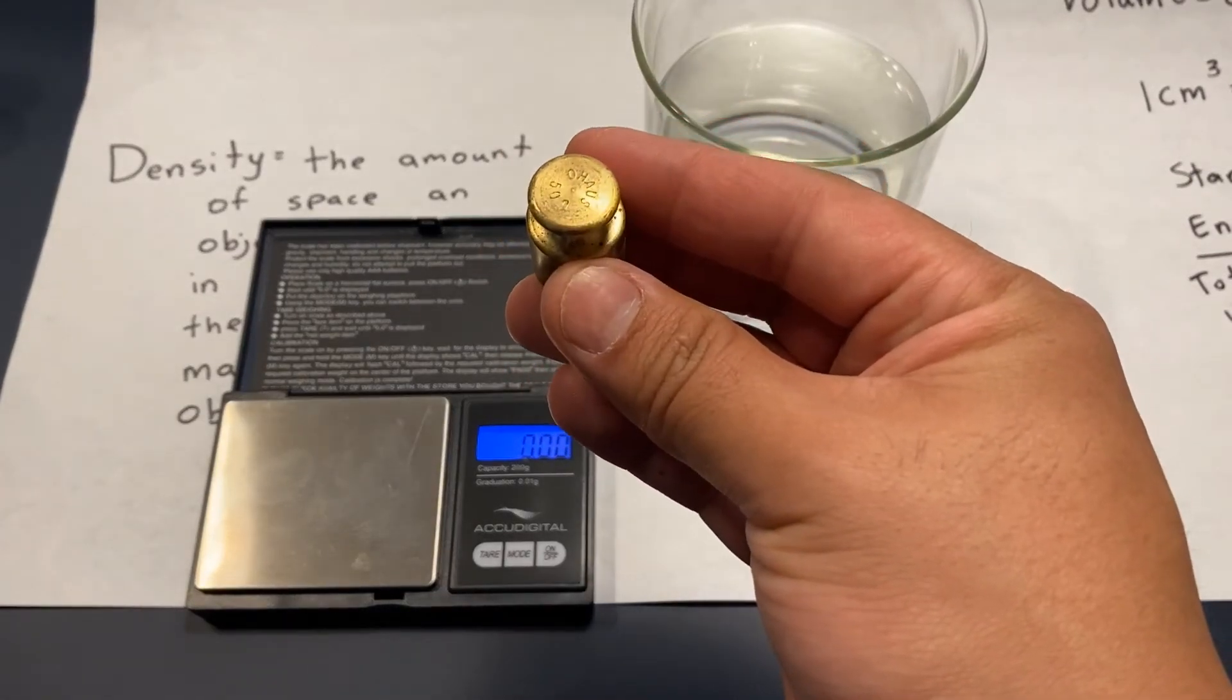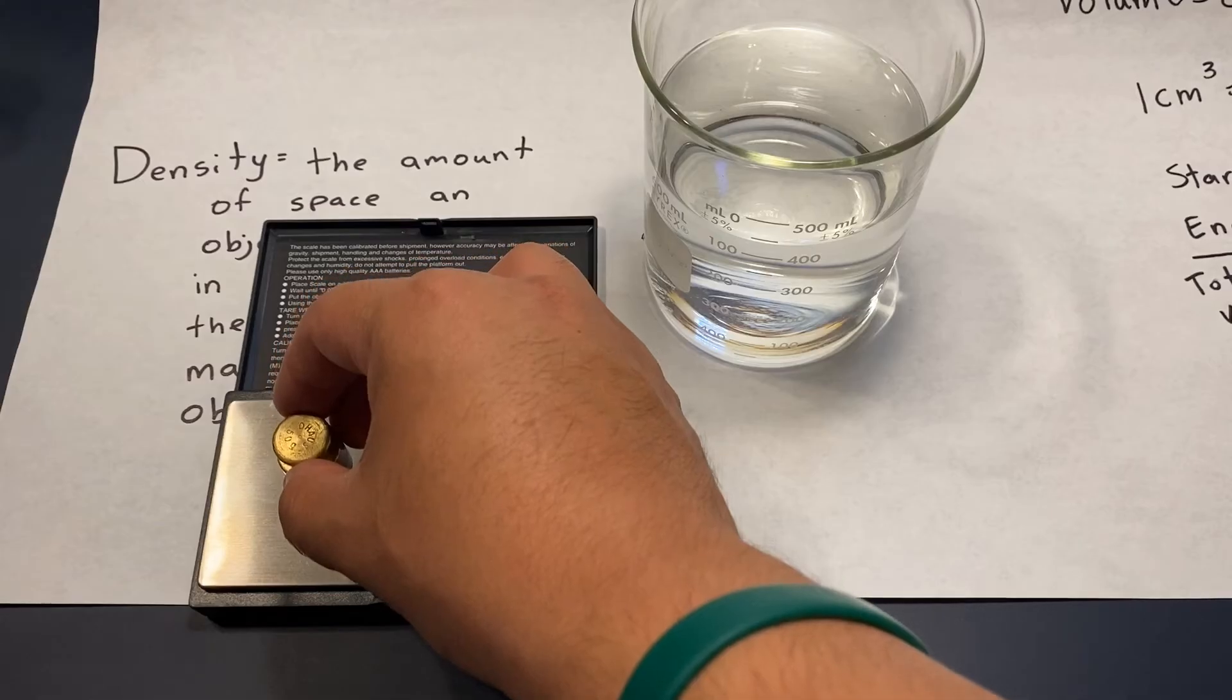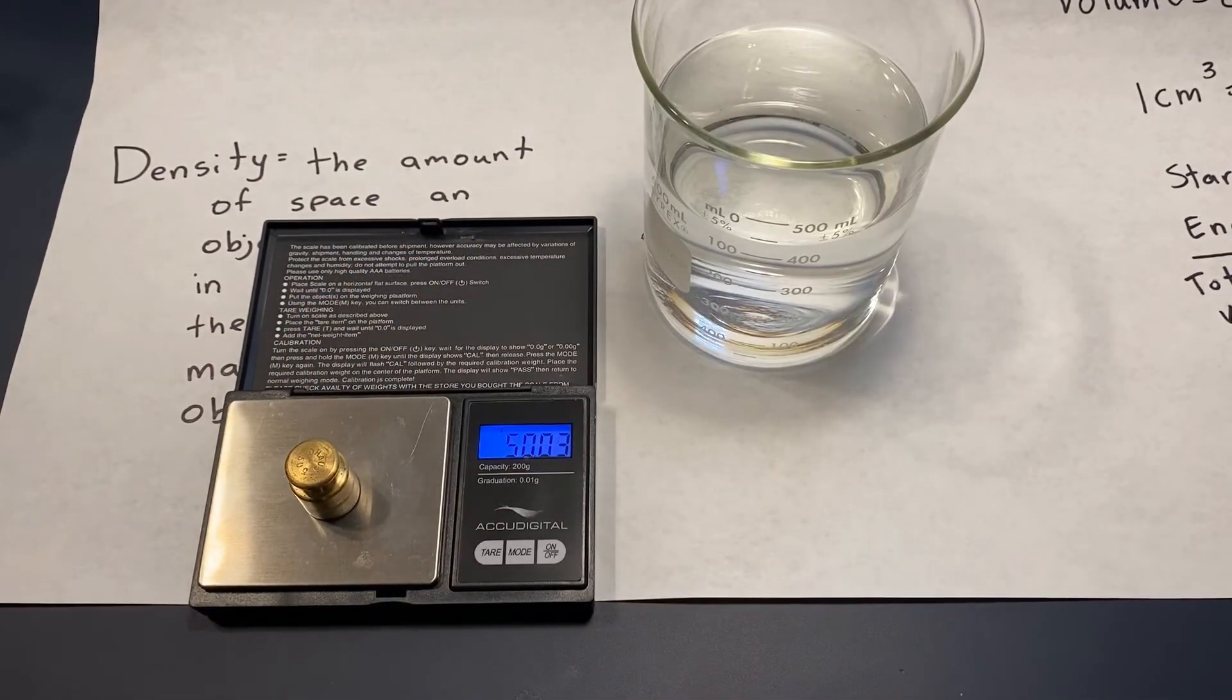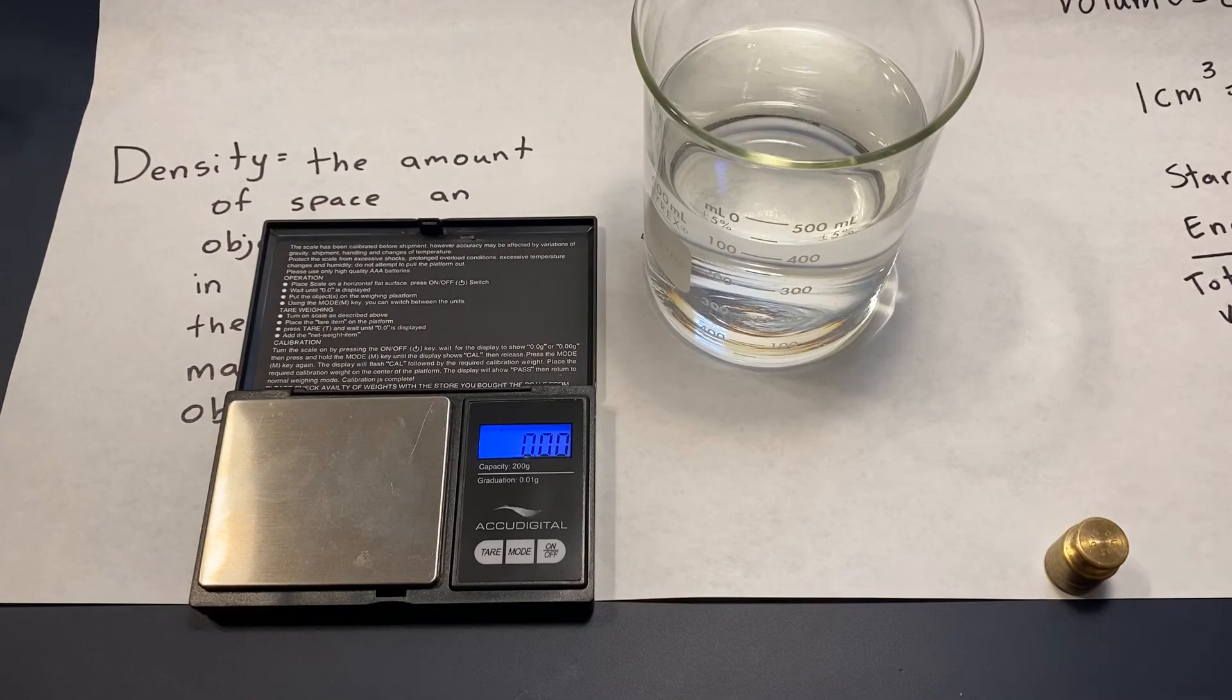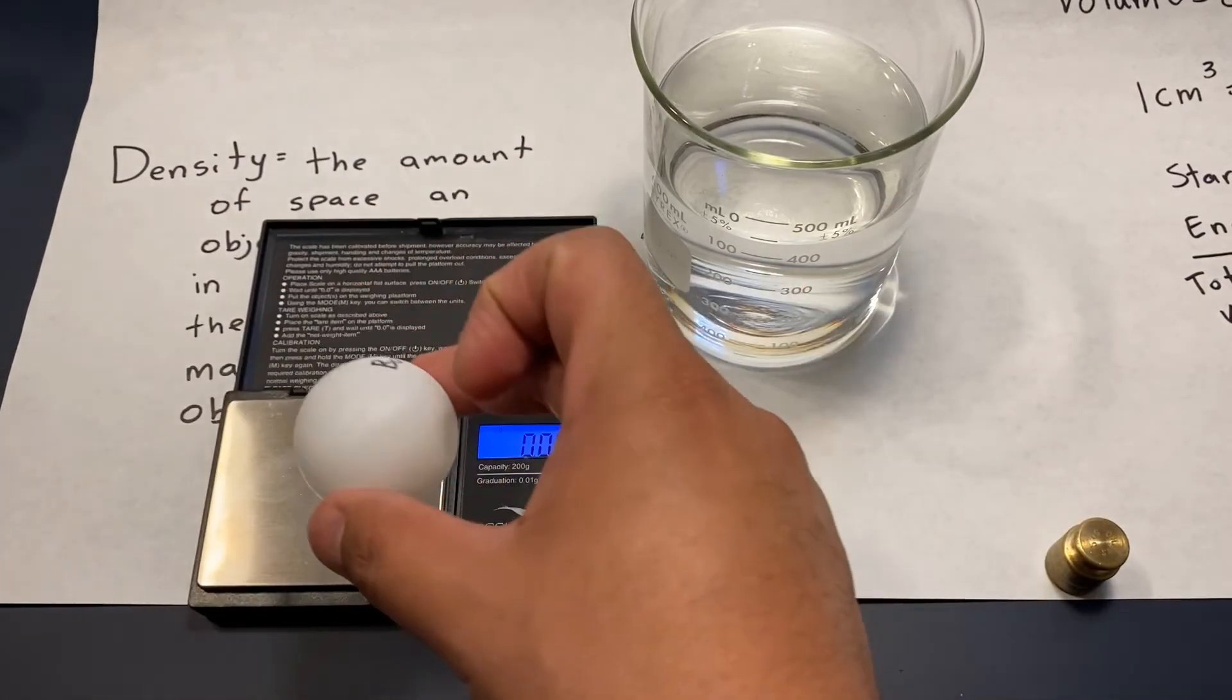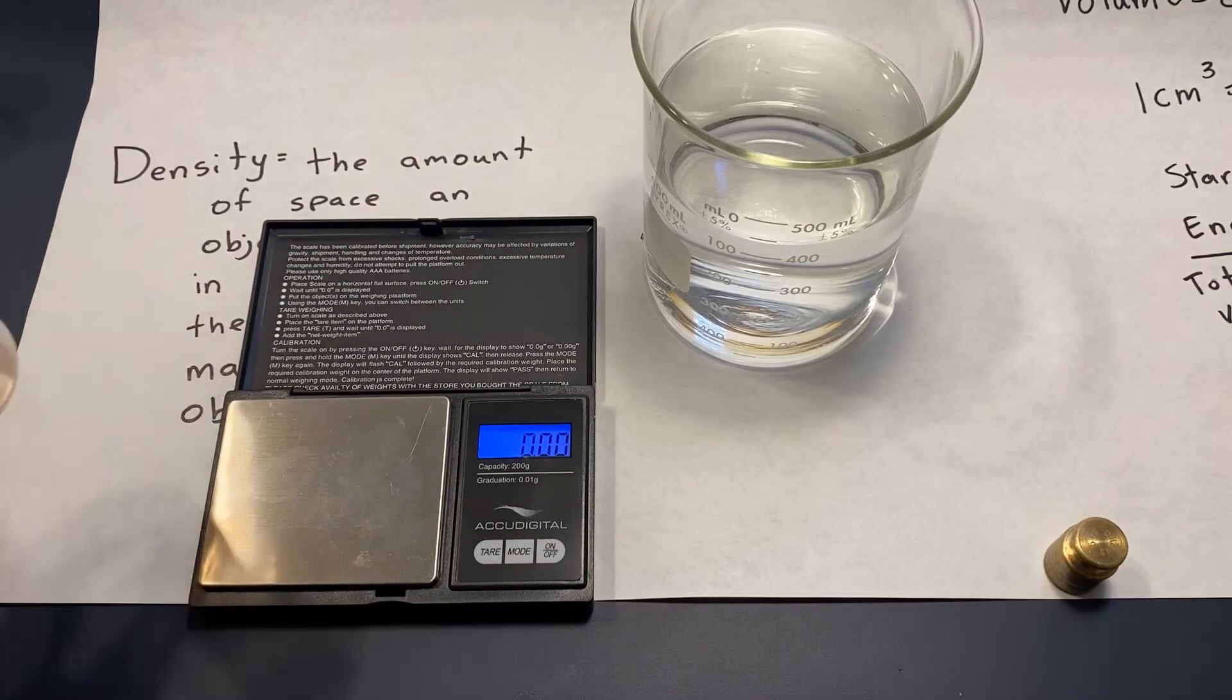Okay, so this is a 50 gram weight. Place it on the scale, give or take, there it is, 50 grams, perfect. Let's move that one away.